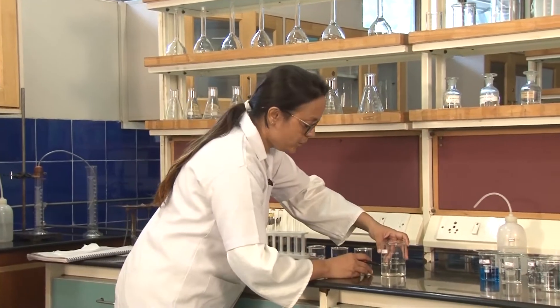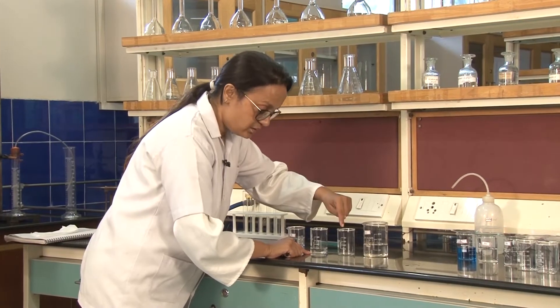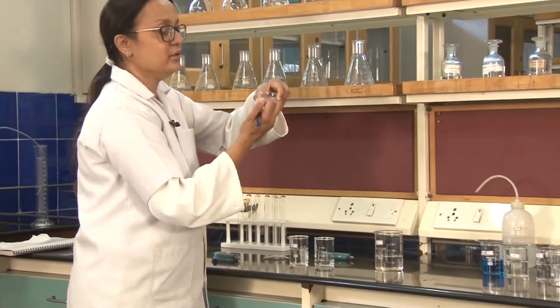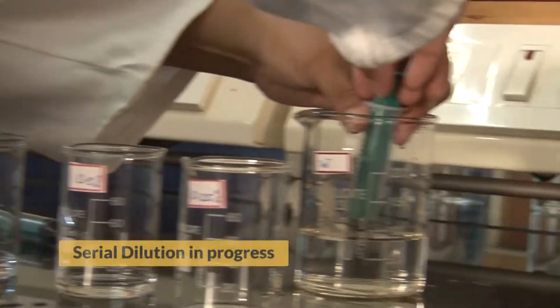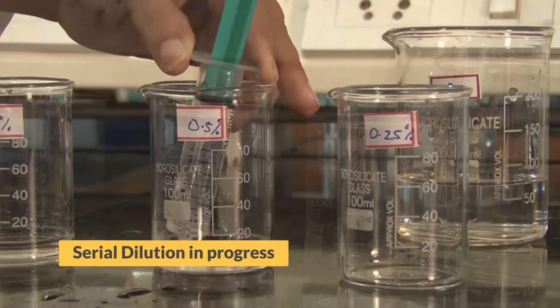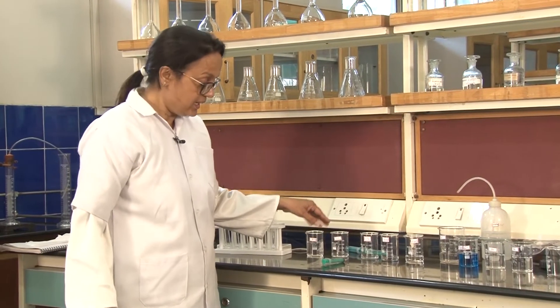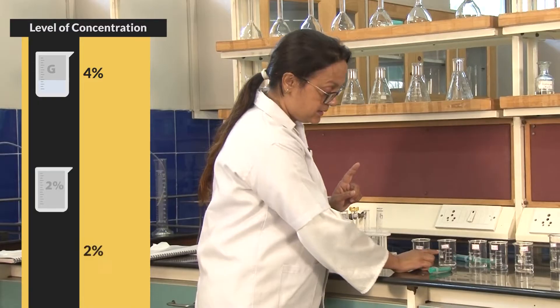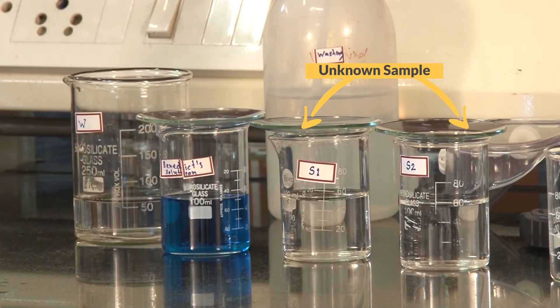For the second step of dilution, we take 10 ml of the 2% solution and add 10 ml of distilled water to a new beaker, making it 1%. We continue two more steps. Now all serial dilutions are ready: G at 4%, then 2%, 1%, 0.5%, and 0.25% solution.